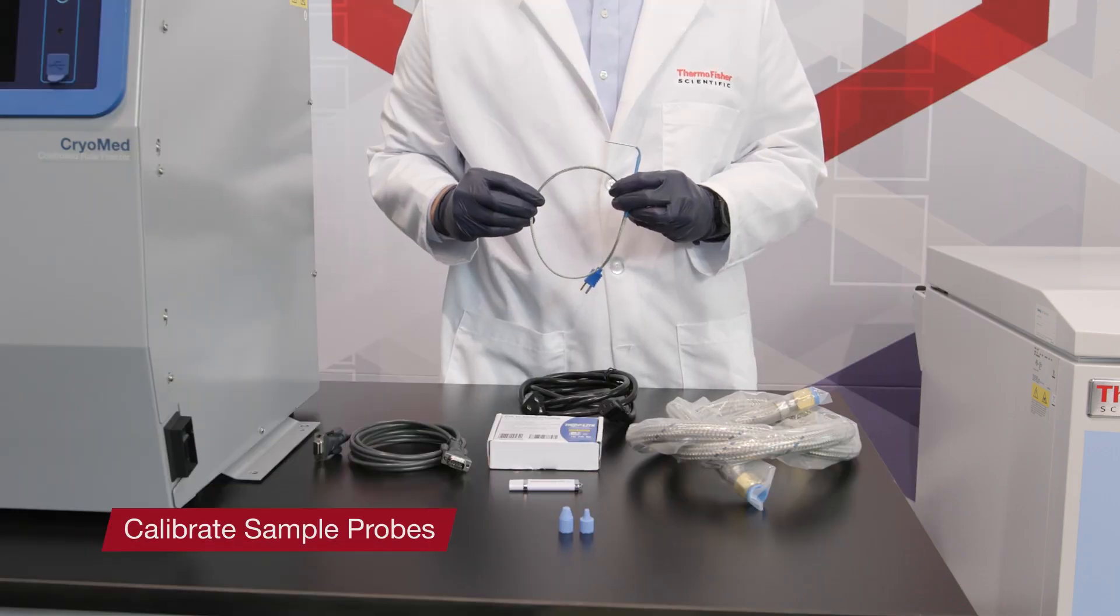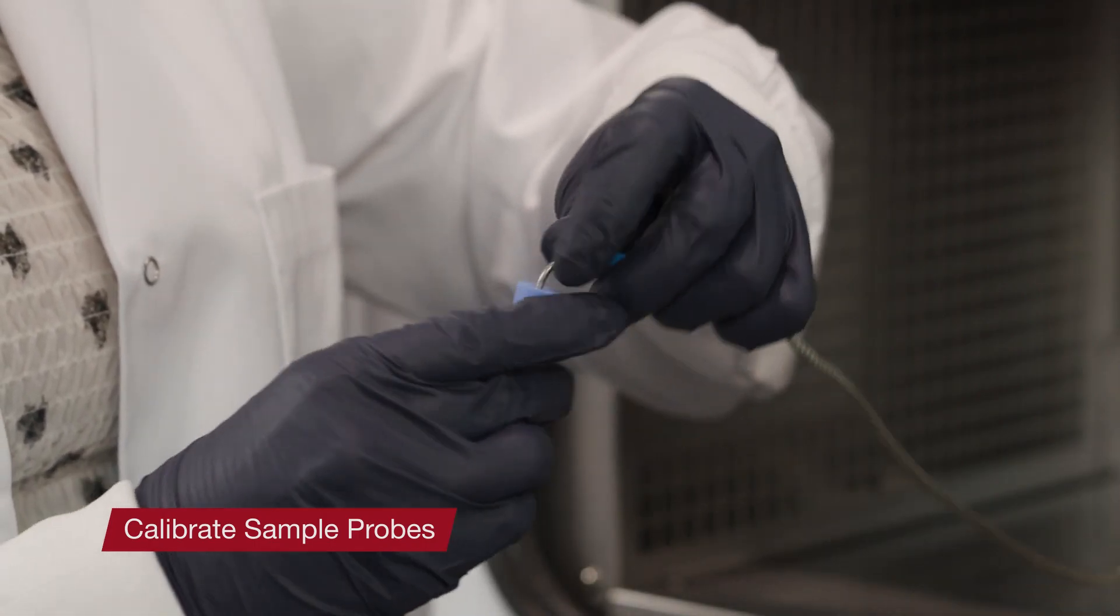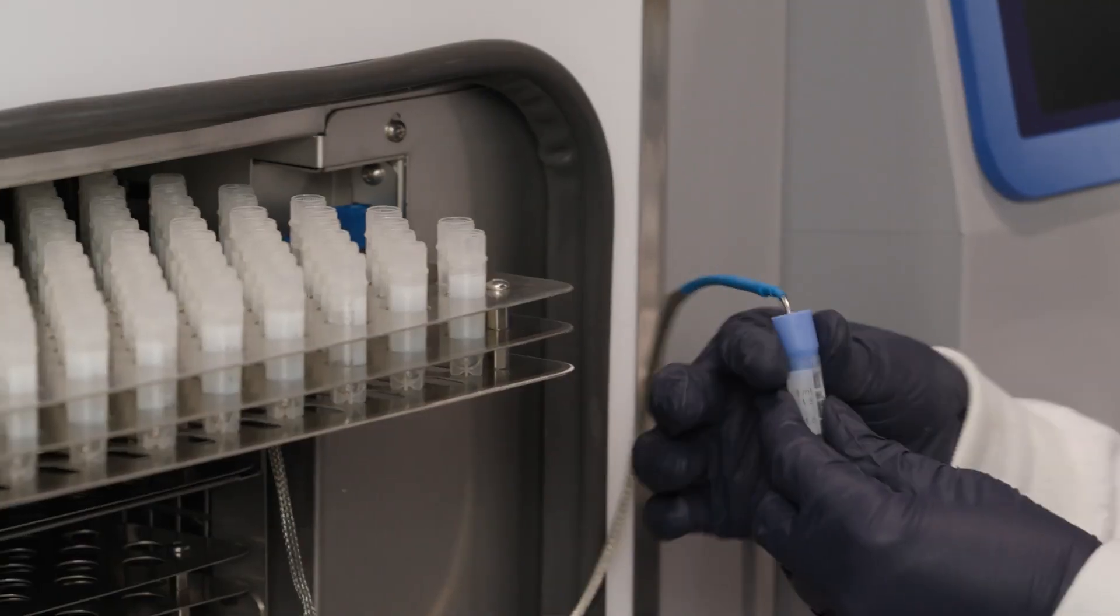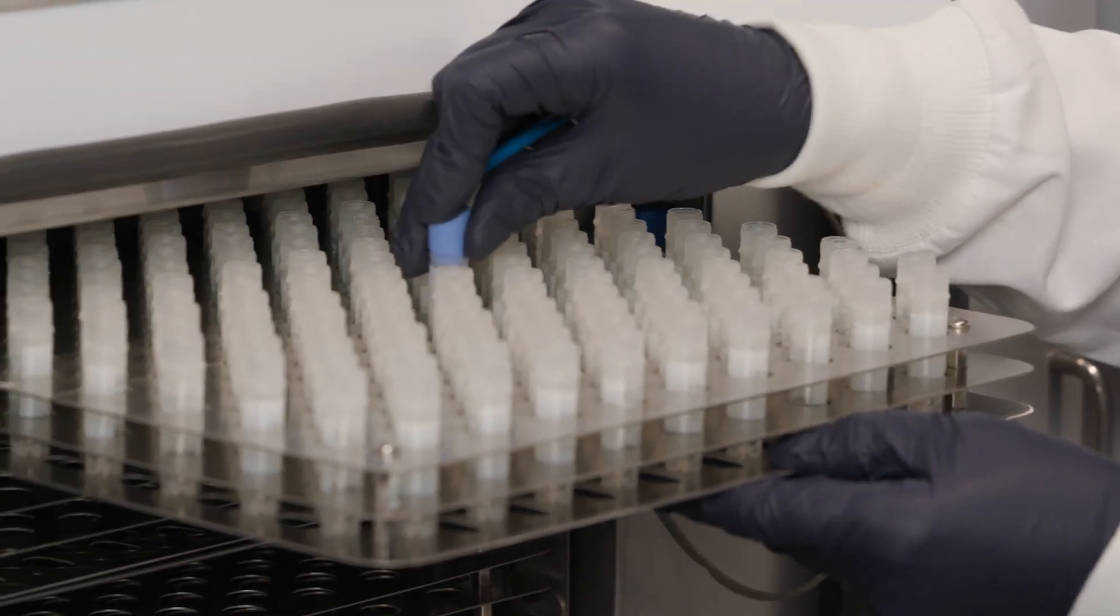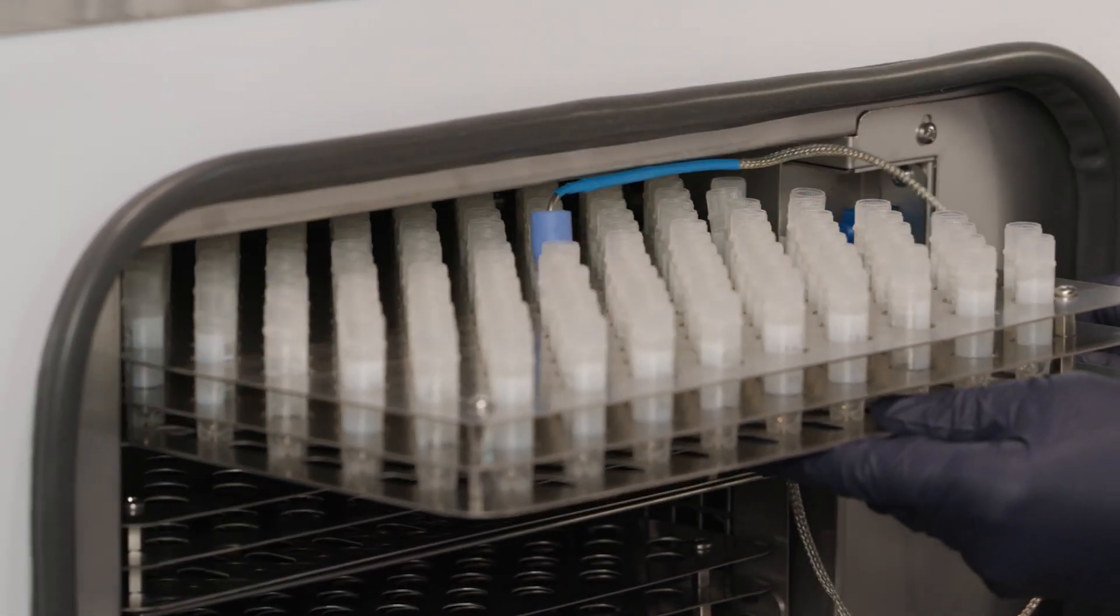Calibration of sample probes should be handled by trained professionals and under specific qualifications needed for your application or facility. We recommend contacting Thermo Scientific Technical Services if you have any questions related to probe calibration.